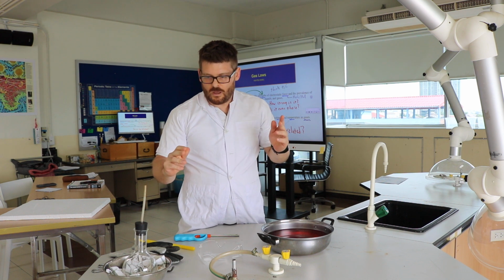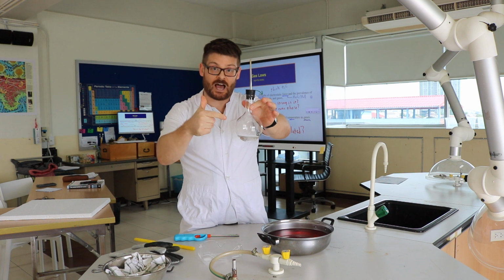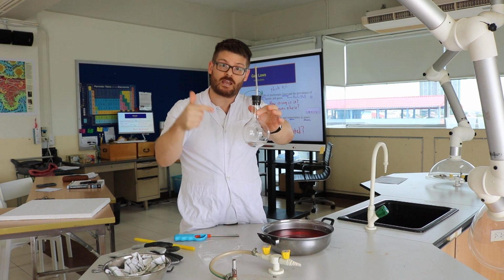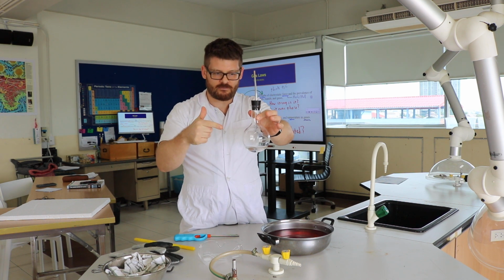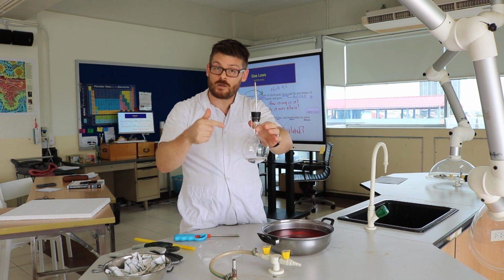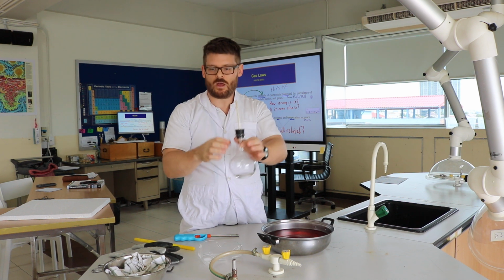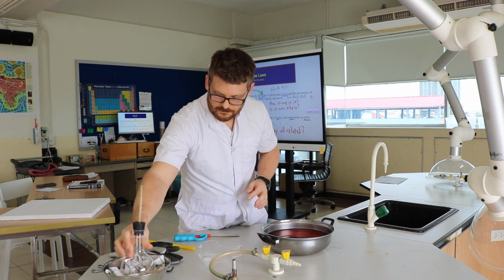Okay? So, before we start, I want you to think about what's inside the flask right now. Okay? Think of everything you can that's actually inside of there right now. And then we're going to go through a process of change. So what's inside there now, and what's it going to change into as we go through this process.